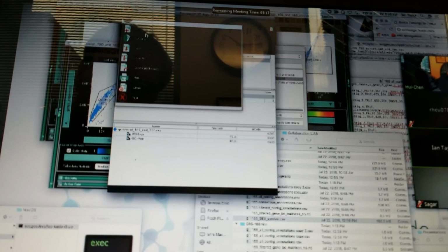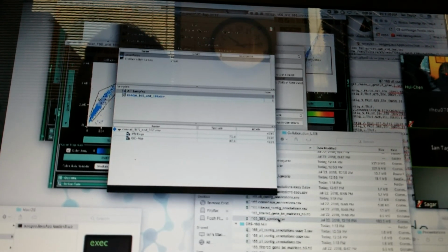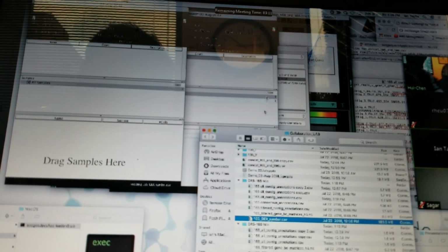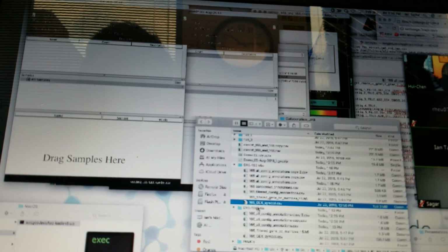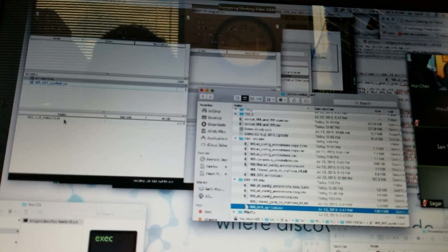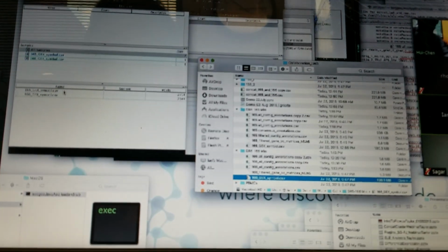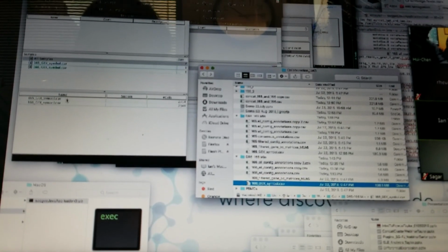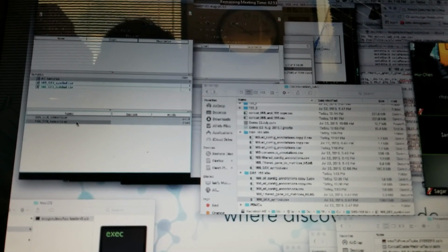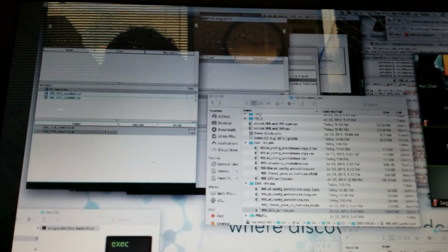So let's see. New workspace. I'm just going to add the two expression files that we're dealing with in this case, the 165 gene expression file and 166. What about the VDJ? So we haven't got into the VDJ stuff yet at all. But you just mentioned that you didn't have any combined data files. Okay, well that's the first step, right?